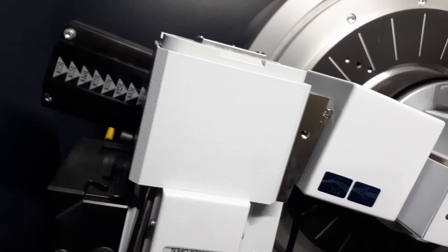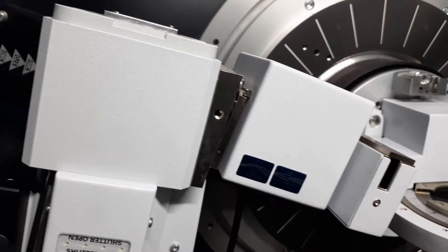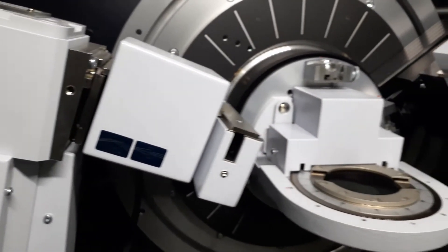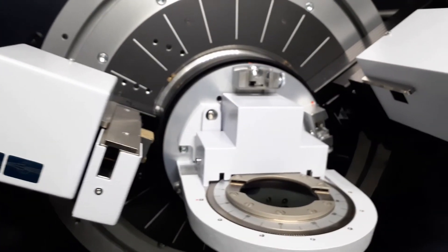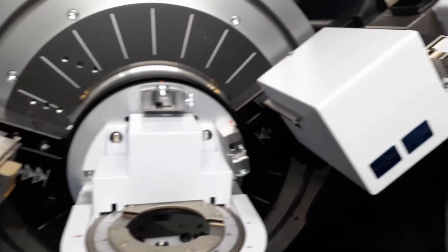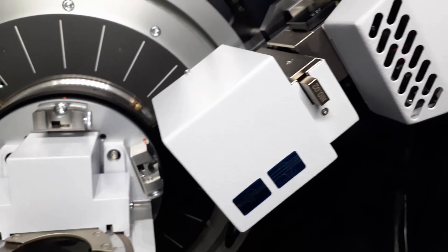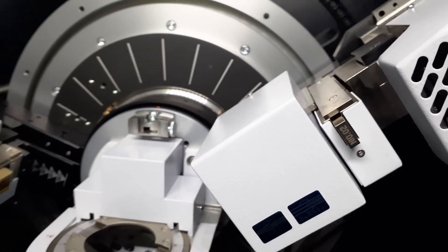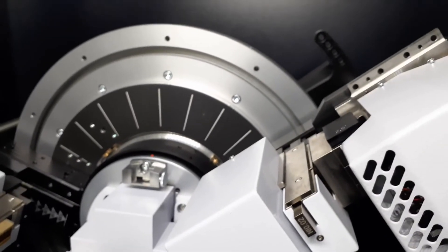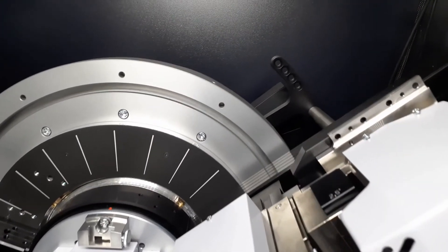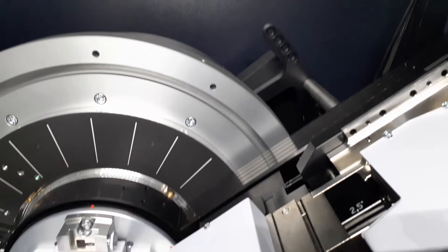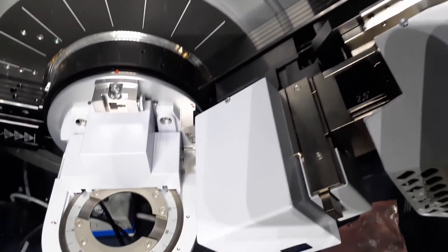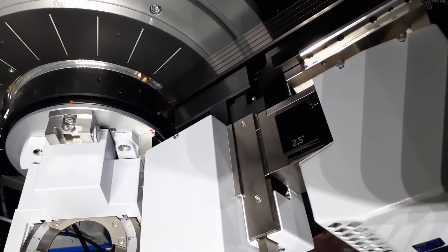This is the configuration for powder diffraction. First, we have the x-ray tube, then the twin primary motorized slit, then sample stage, then twin secondary also motorized slit, then the filter system, finally the SSD 160 detector. Also, it is necessary to put a 2.5 Soller slit.